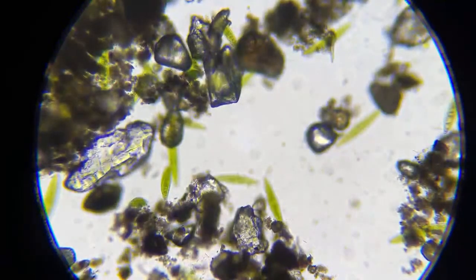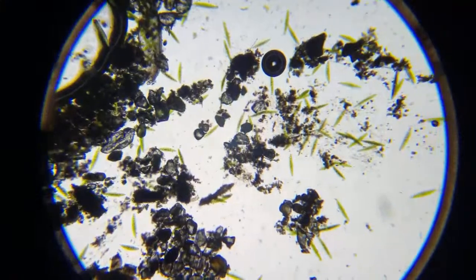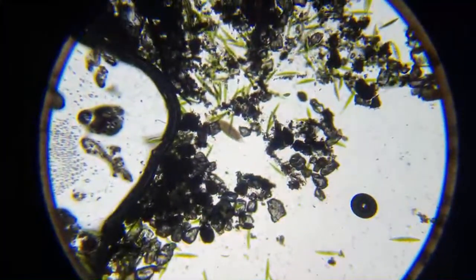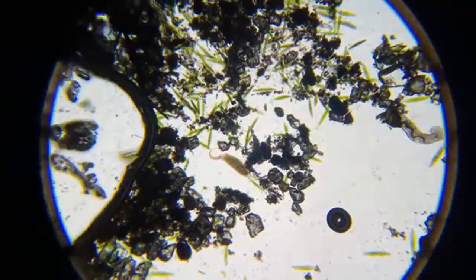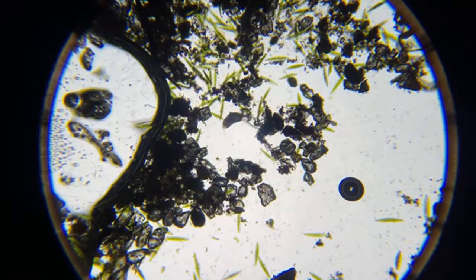Okay, this is going to be my first YouTube live stream directly from a microscope through the iPhone, and we'll see if we get any visitors here. I have a couple of things on here. This guy right here in the middle is a Dileptus.